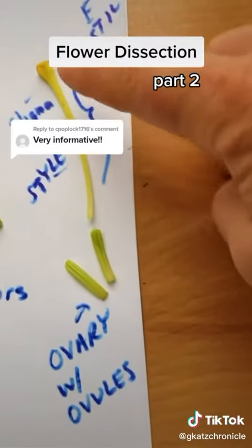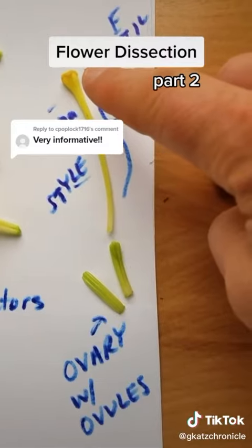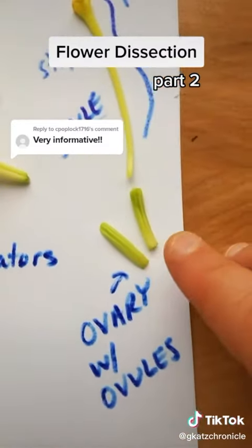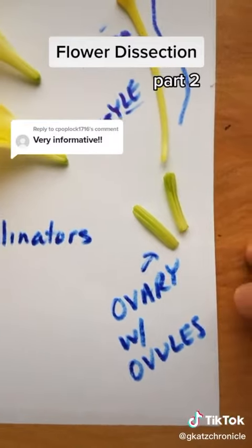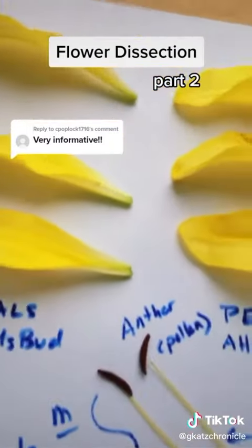All right, and this upper part of the pistil is the stigma, which catches the pollen grains, and then we have the style. And I've cut open the ovary. With a microscope, you could examine the ovules inside, which become seeds. This is the receptacle, which holds the flower to the stem.